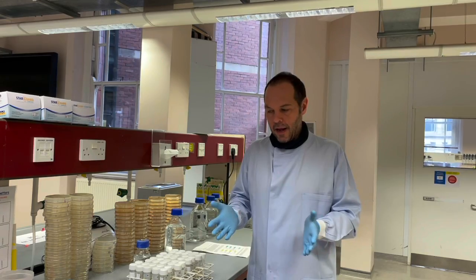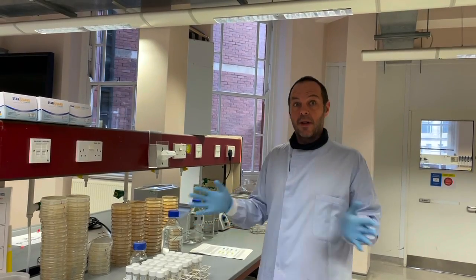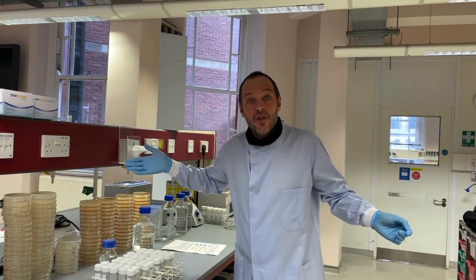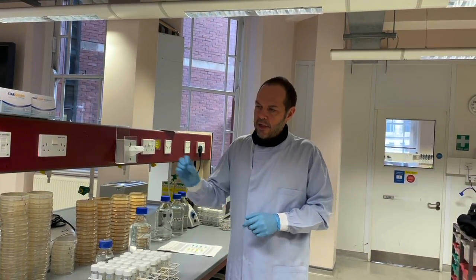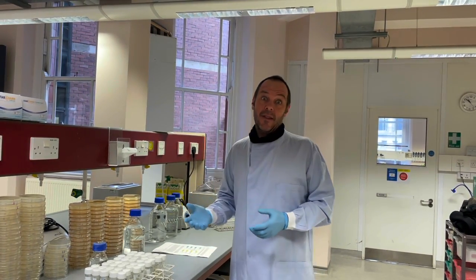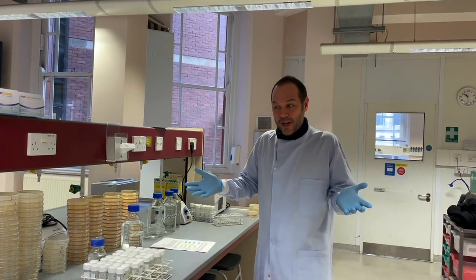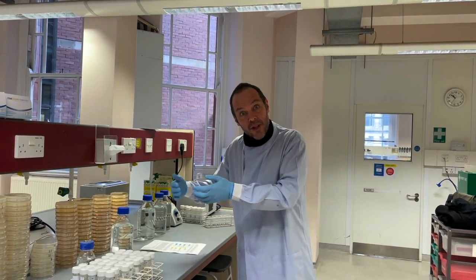We'll essentially be doing replicated experiments. So we'll do this a few times. I'll only record it once though. Each of you would be doing the same experiment, so we'd have all these replicated experiments. And I want you to think about why, if you started with the same biological material, this goes back to my overall theme for this course: how repeatable is evolution? If you want to do experiments to determine how repeatable evolution is, the cool thing about experimental evolution is you can do the same experiment again and again and again, and then you can see what the variation is in the outcomes.